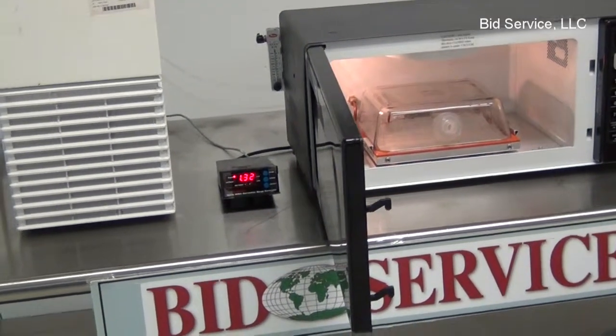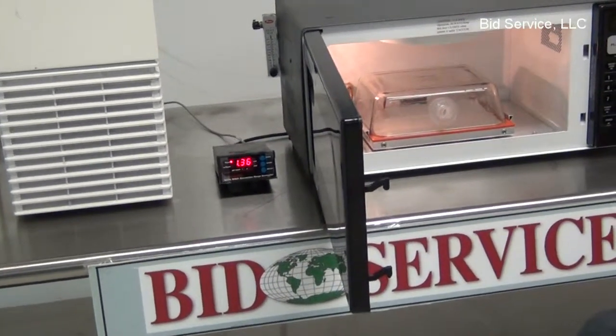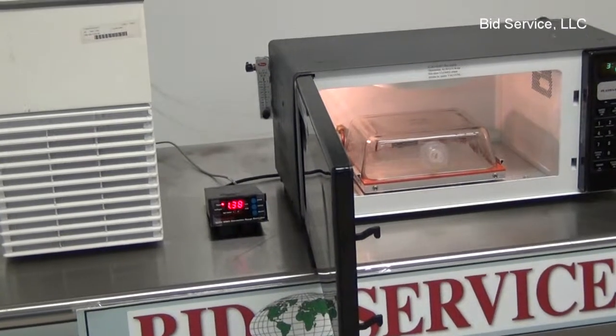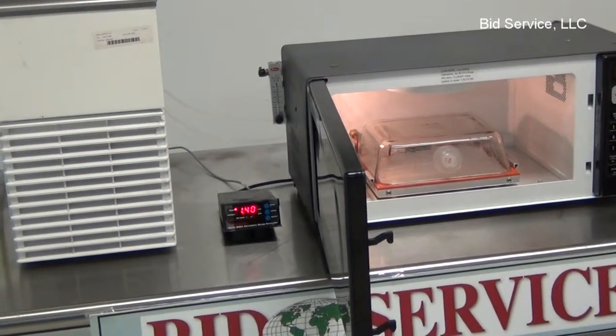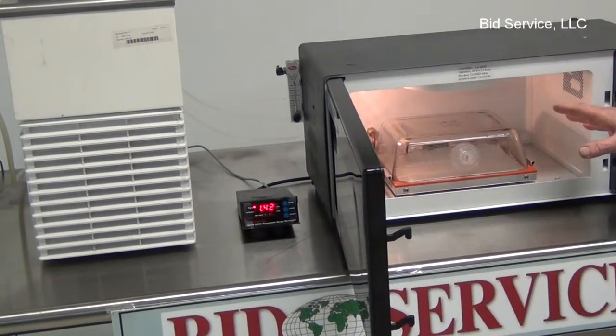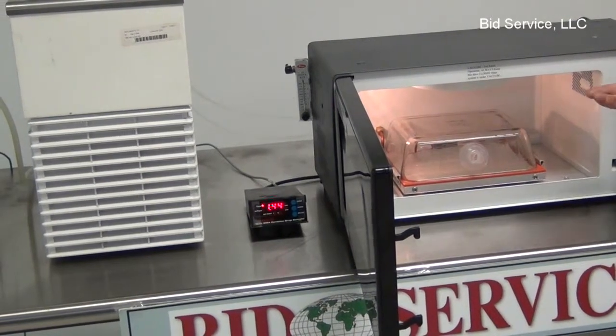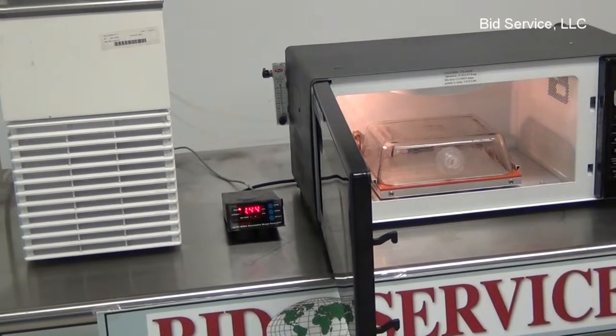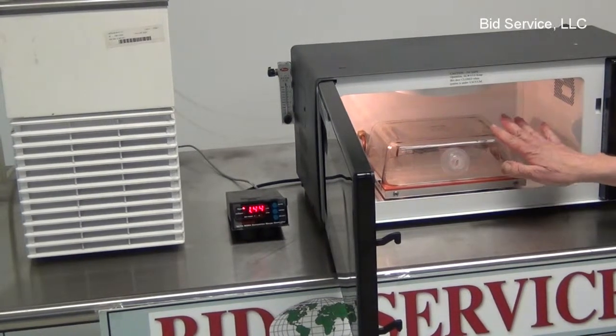Another thing to mention from a safety standpoint is if you are using this at full power for, let's say, any more than three to four minutes, it is Pyrex, but it will get very hot to the touch. So you should give yourself sufficient time after you're done running the cycle for this actual piece of glass to cool down.